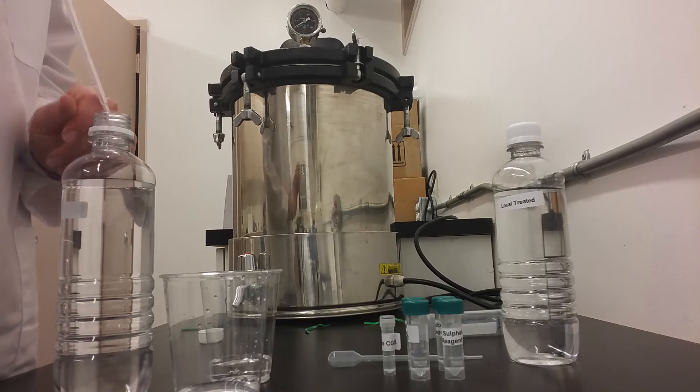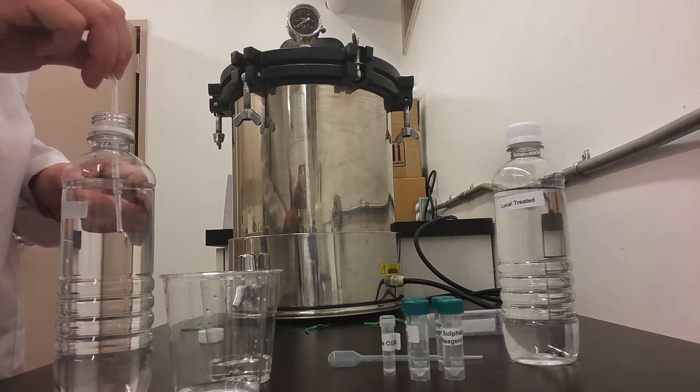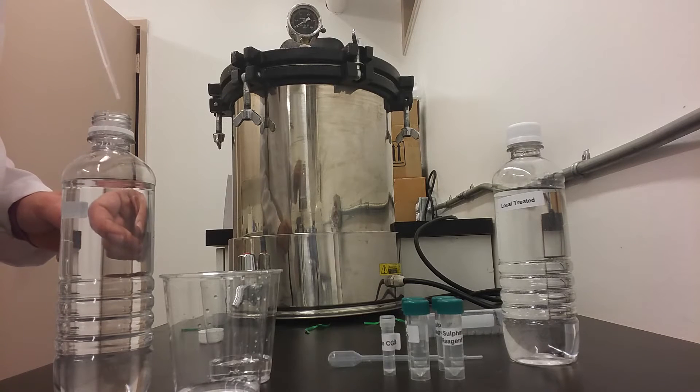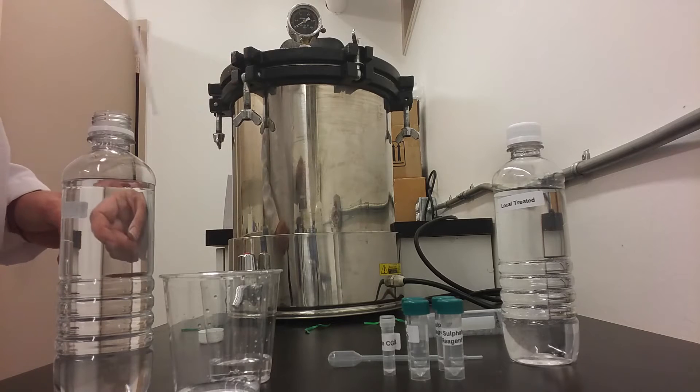To begin with, for the control cup, we will take two milliliters of water using the pipette and add it to the control cup.